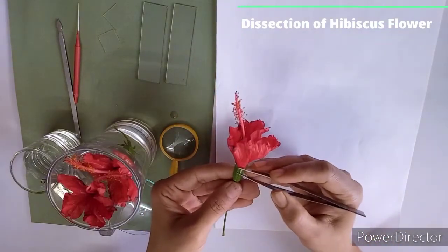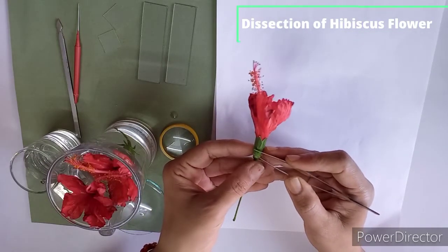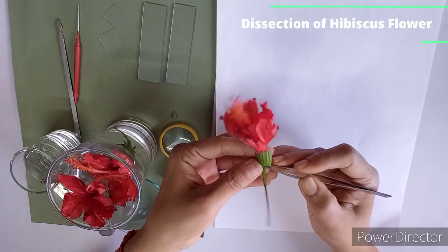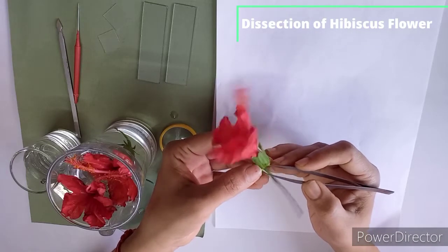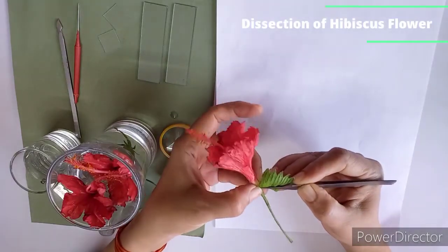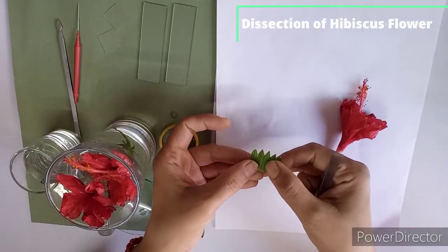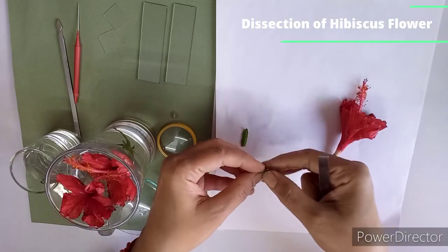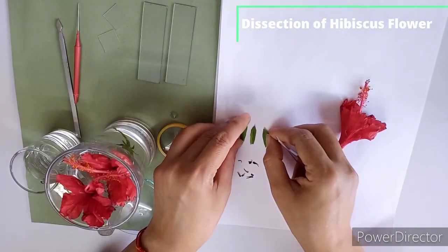and then I am dissecting this calyx. You can see this green part, this is what calyx, or you can see here in calyx 5 sepals are there. So dissect like this way. Now you have to dissect it carefully. So this complete whorl is called as calyx. So I am dissecting here this complete whorl. You can see this is calyx. Yes. So this complete structure is calyx, and if you are separating the single unit, the single unit is called as sepal. So this single unit is sepal, and altogether the complete whorl, that is calyx.